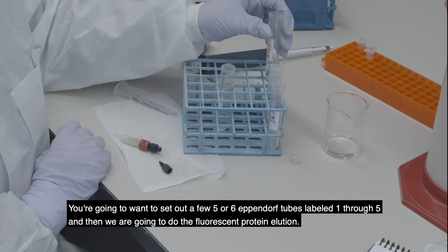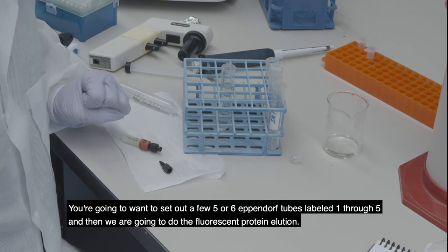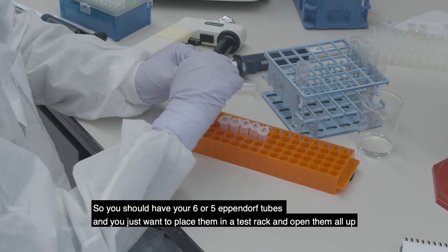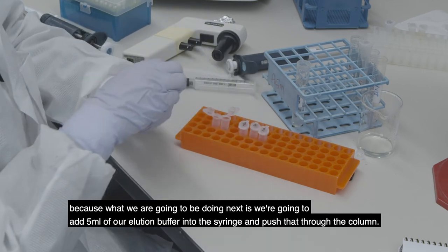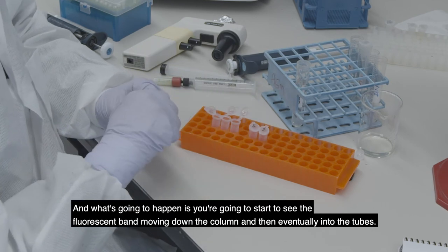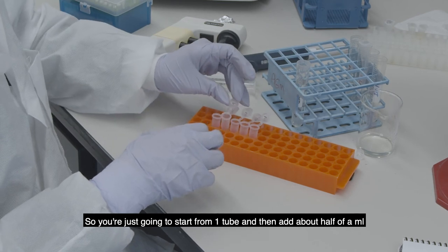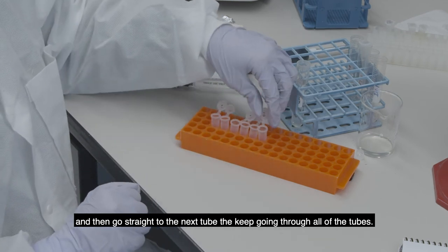Set out five or six Eppendorf tubes labeled one through five — we're going to do the fluorescent protein elution. Place them in a test rack and open them all up. We're going to add 5 milliliters of elution buffer into the syringe and push it through the column. You're going to start to see the fluorescent band moving down the column and eventually into the tubes. Start from tube one, add about half a milliliter per tube, then move straight to the next tube and keep going through all the tubes.